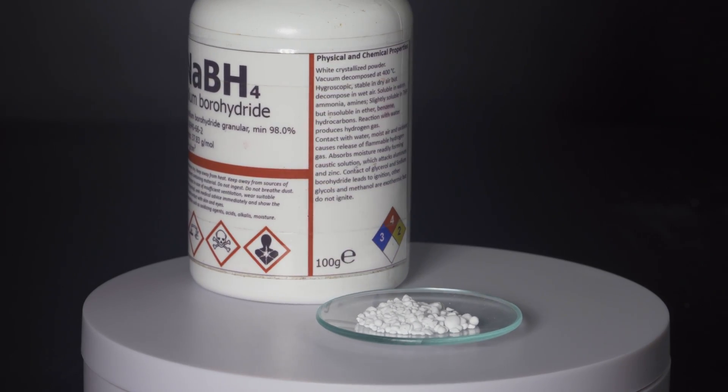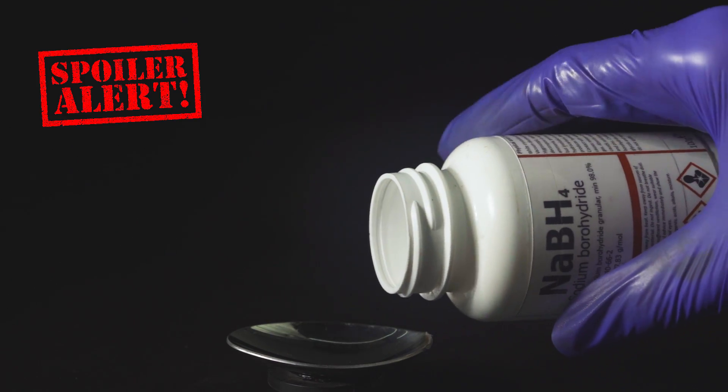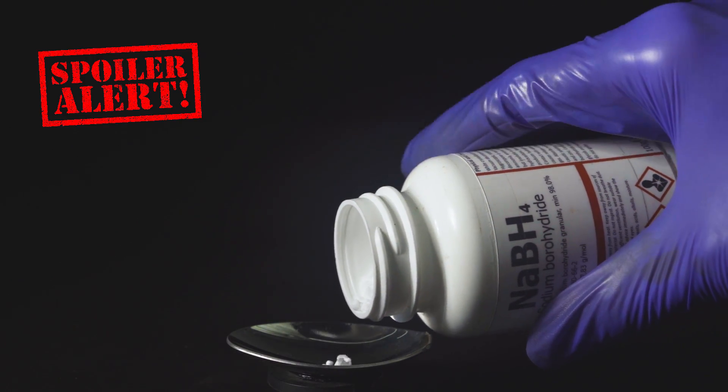Coming up next, sodium borohydride. This reaction happened to be the brightest among the others in this video.